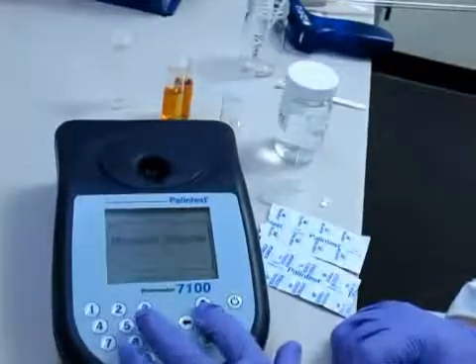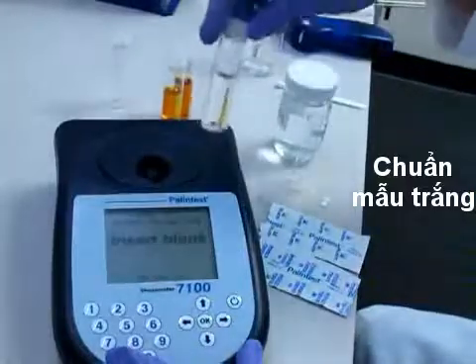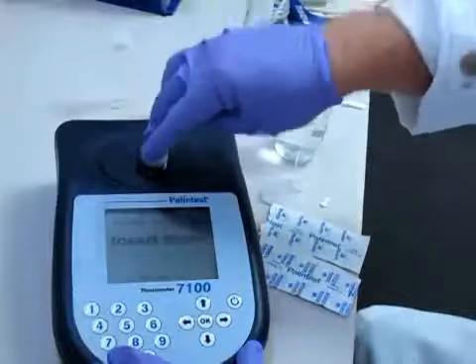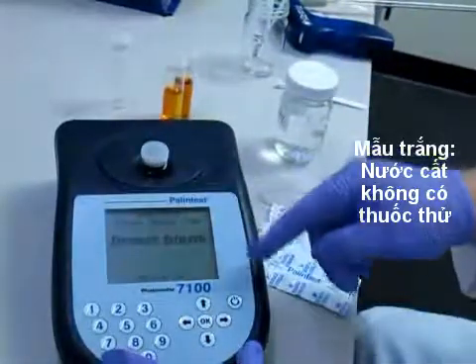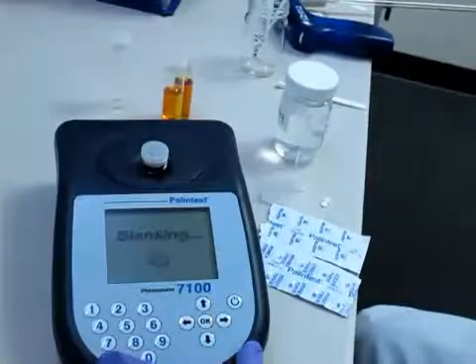It'll ask you to put in a blank. The blank is just your water sample with no tablet added. Insert the blank it says and push ok. It will take a few seconds to blank the instrument.